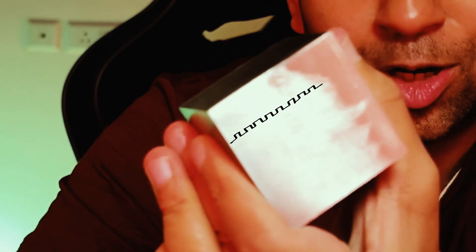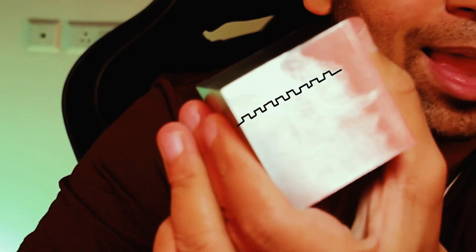For accurate test results, the hardness reading has to be taken on a flat specimen with a polished surface. Since this specimen was cut from our plate, the surface could still have ridges and grooves at a microscopic level that can impact the hardness readings.